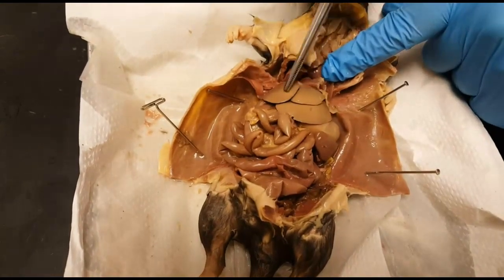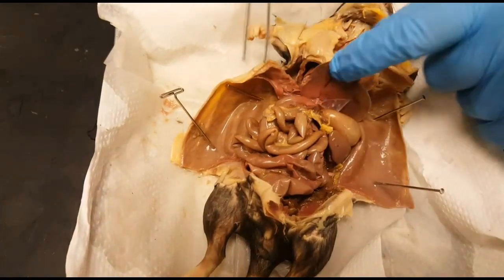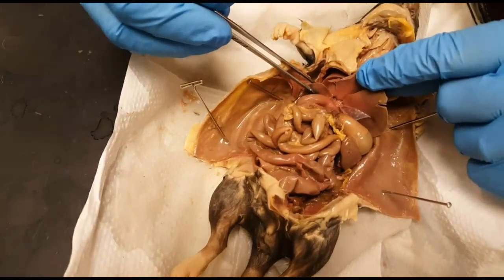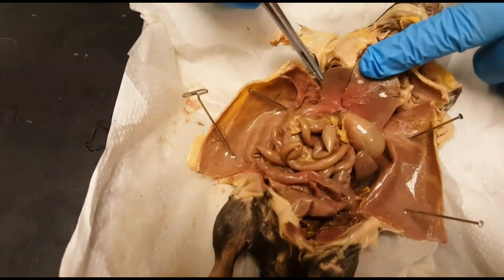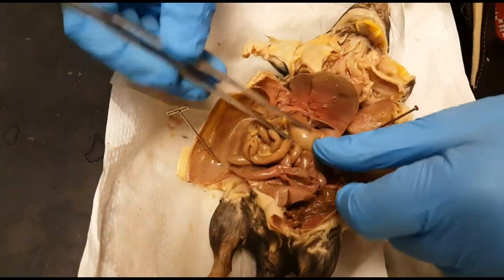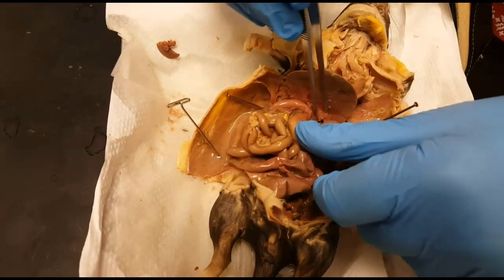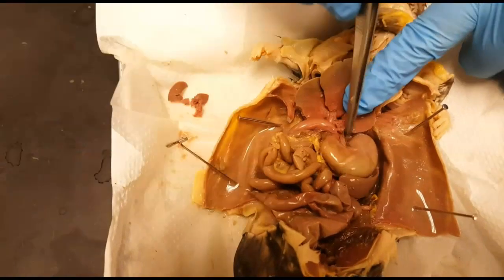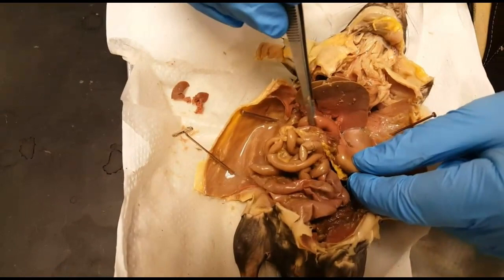Below the diaphragm we have a dense tissue called the liver, made up of many lobes. Inferior to the liver we have an organ that is typically attached right underneath it called the gallbladder — rats actually do not have a gallbladder, whereas humans do. Here we have the stomach, which is made up of a fundus, body, and antrum, that leads into the small intestine — the first part of which is the duodenum.